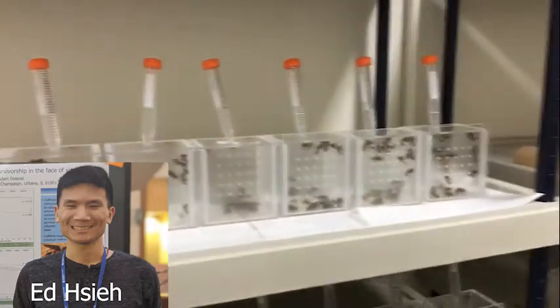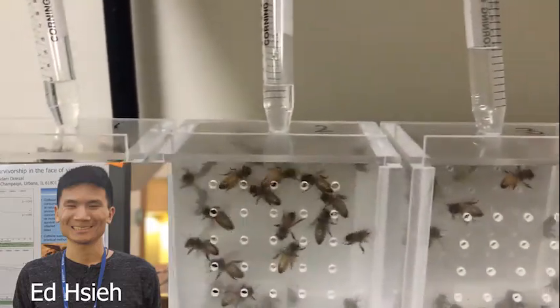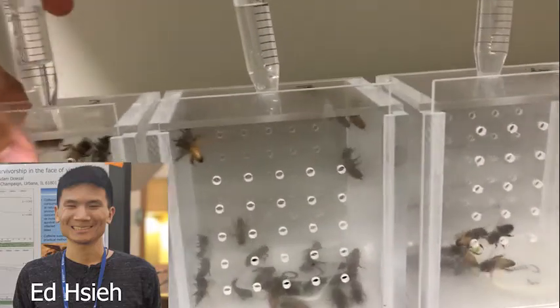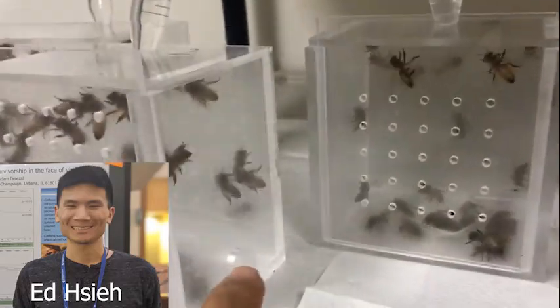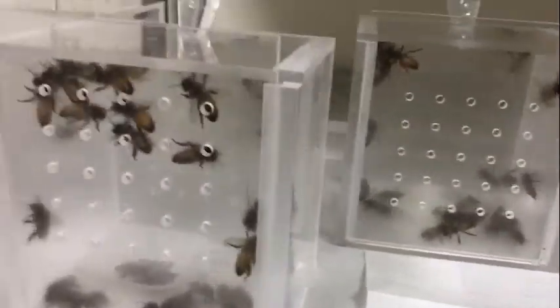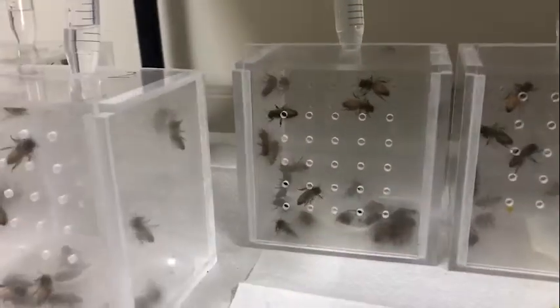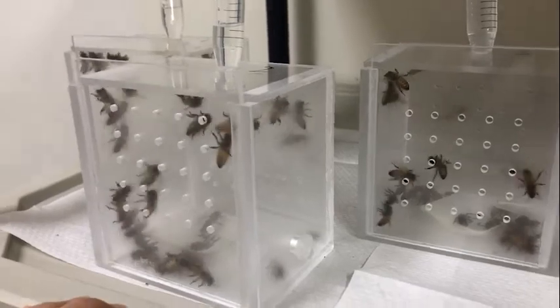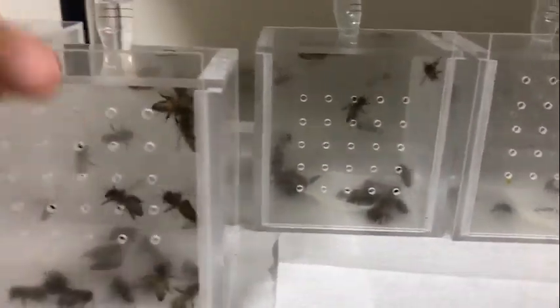But instead of grafting them into queen cups and putting them into a colony, we are going to rear them all in the lab in cages that look somewhat like this, with two feeder holes. You have a sterile top side and a controlled condition, where we can then manipulate the environment that the bees are exposed to, whatever the experiment desires. We can see here petri dishes set up with this diet.